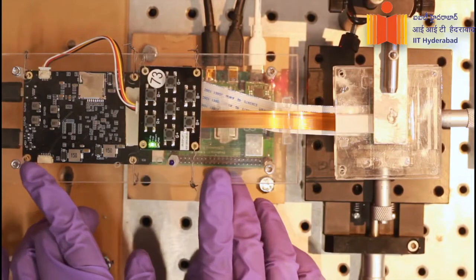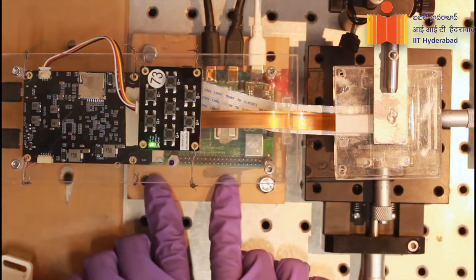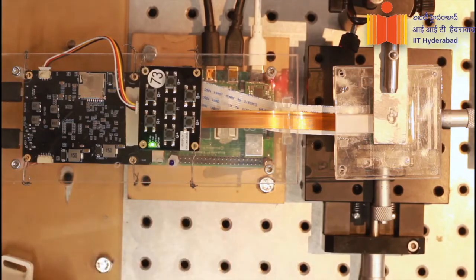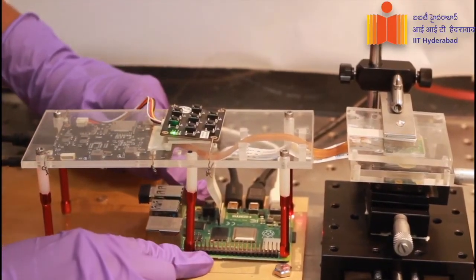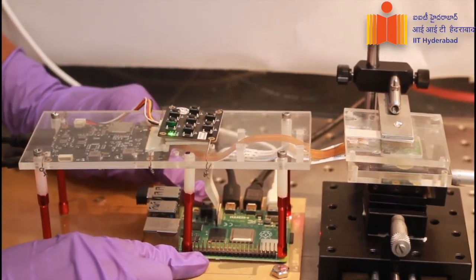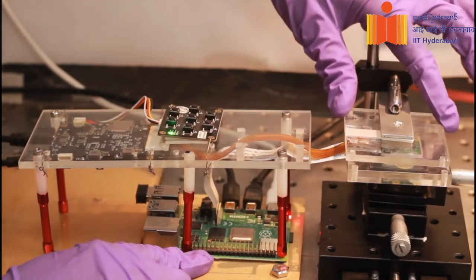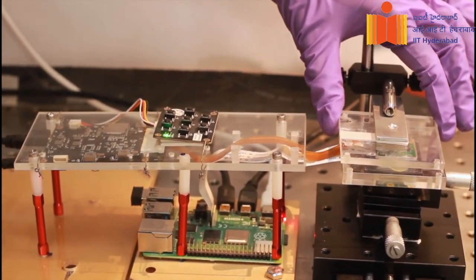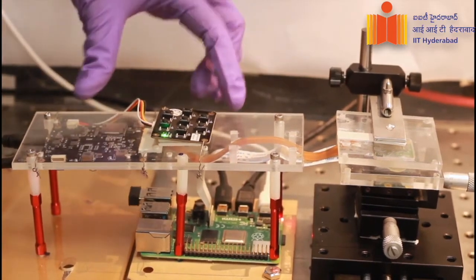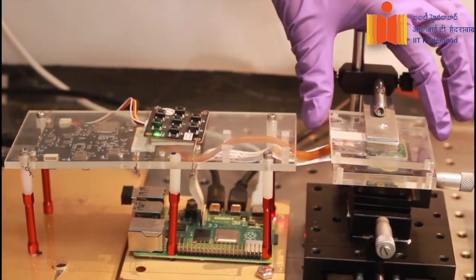This is the driver board which interfaces the micro LED display with the single board computer. The micro LED board is connected to the single board computer using a micro HDMI cable. This board considers the micro LED display chip as an extended display. The micro LED control board is used to control the brightness and the actuation of the micro LED chip.